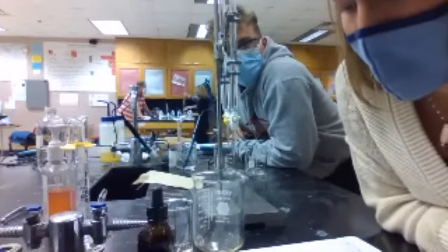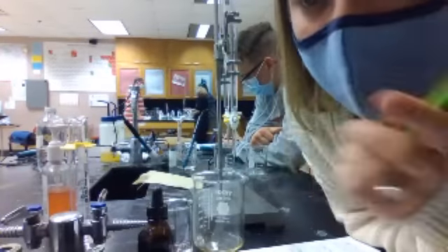You said 19.98 is the volume of the acid? The final volume of the acid, yes. Okay. Is this trial 2 or trial 3? This is trial 2. So is the initial volume the final volume of the last one? Yeah, because we left it. We don't add any more. Sorry, go ahead. 15.68. Okay. Will someone do it just to make sure?